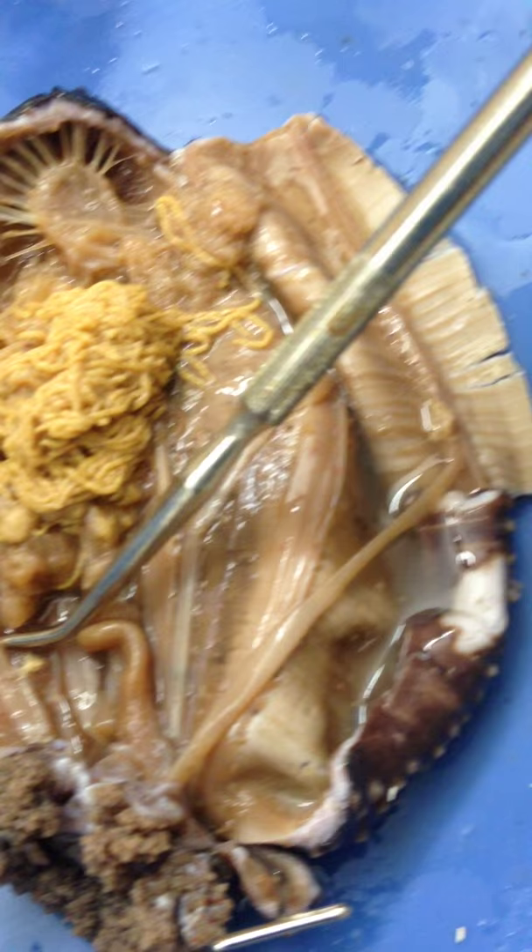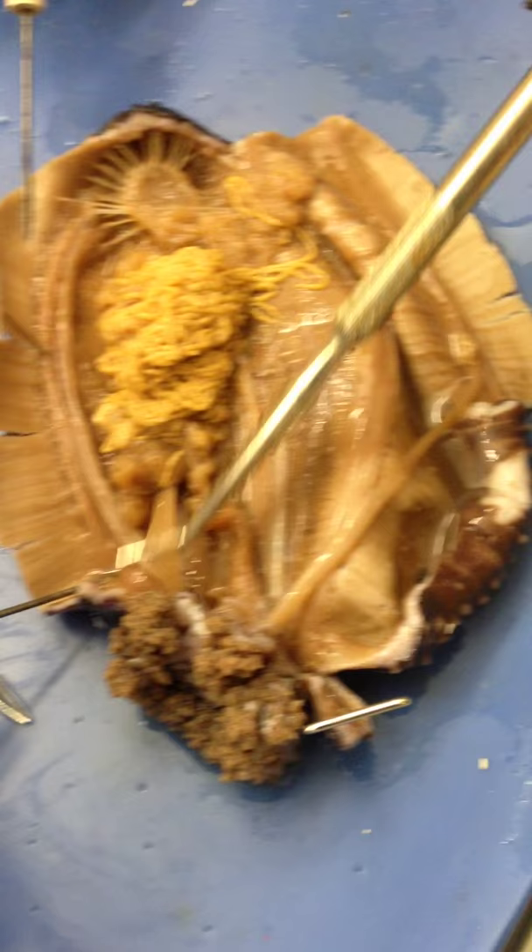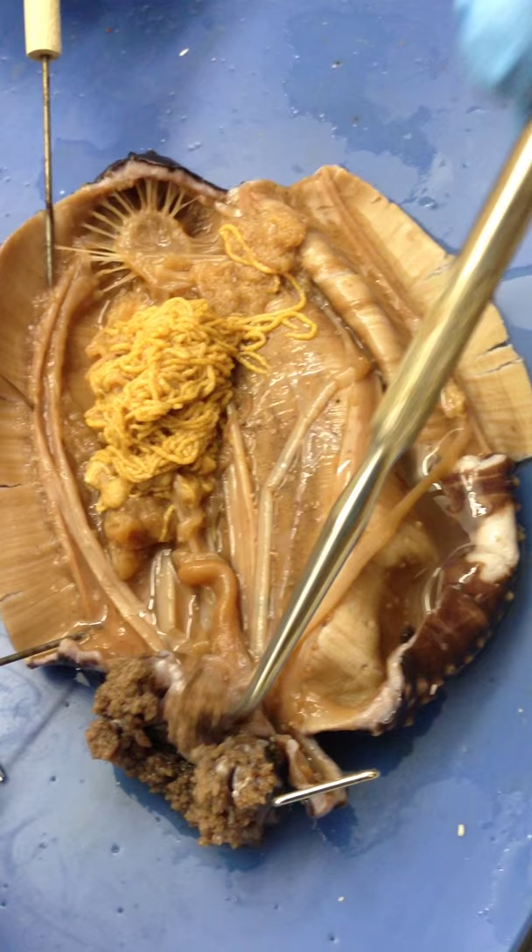This thing, as well as this thing, and this thing, are retractor muscles. They contract the length of the body — they're retractor muscles.